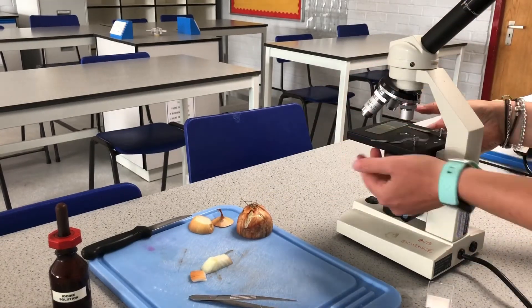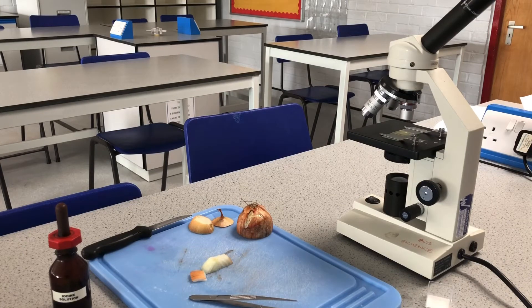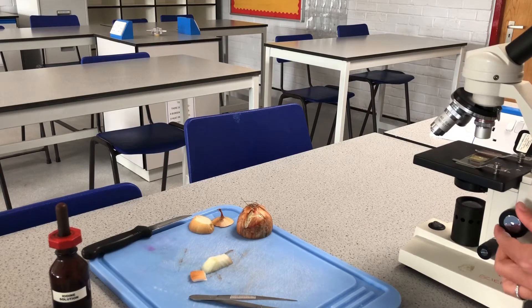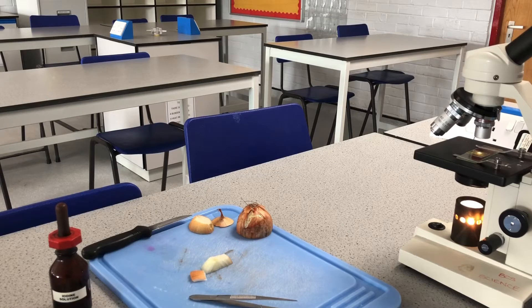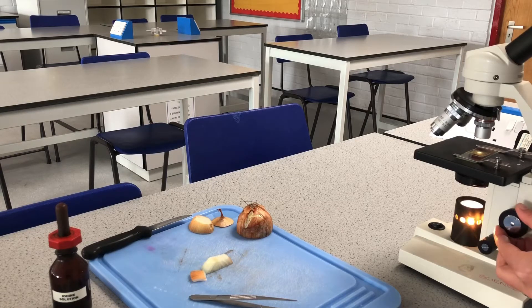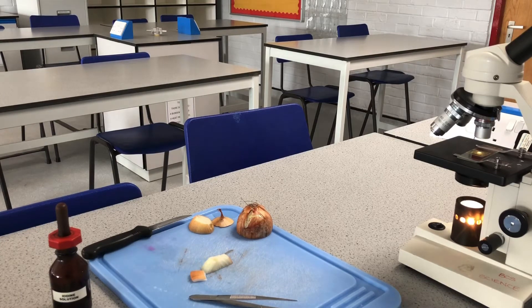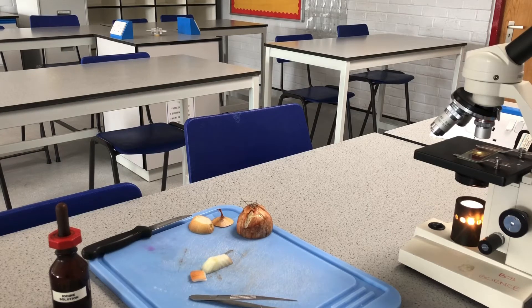I put the slide underneath the microscope and use the clips to hold it in place on the stage. Inside the microscope there is a pointer — really useful for lining something up and showing somebody else. At the moment I can see loads of cells and they look like bricks, all kind of lined up.